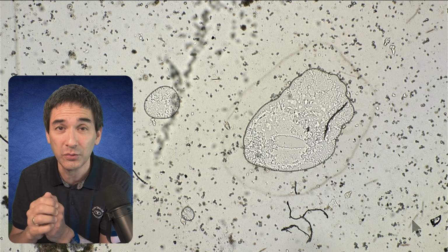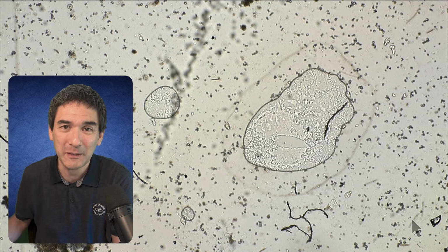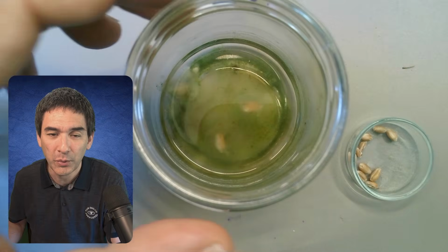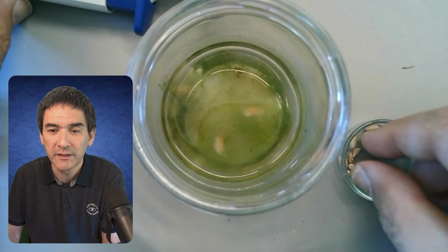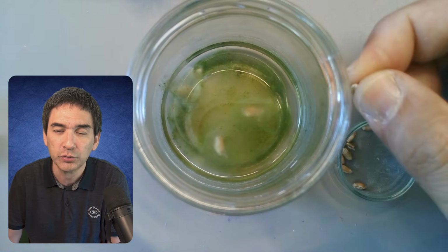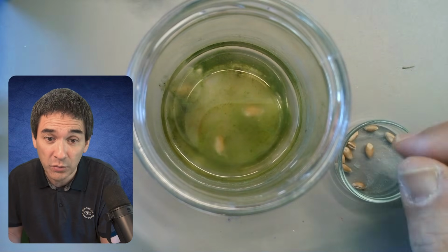If you want to try this yourself, how can you do that? I'm just going to show you a little bit of my own setup. So this is the water sample that I used. It's a pond water sample. You can see it's a little bit green because of all of the algae, but there's something slimy in there. As a matter of fact, these are wheat grains, cereal grains, which I crushed between 2 spoons, and I dropped them in there, and then I waited for about a week or 2 weeks.